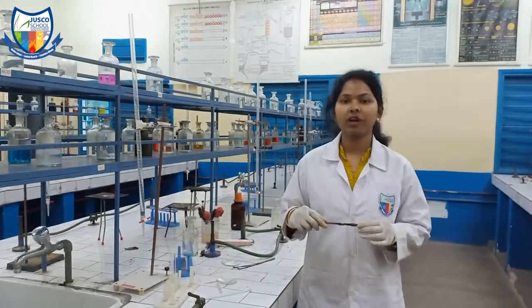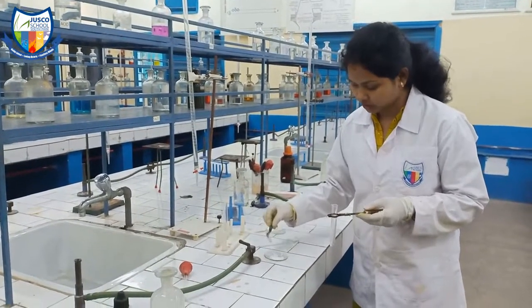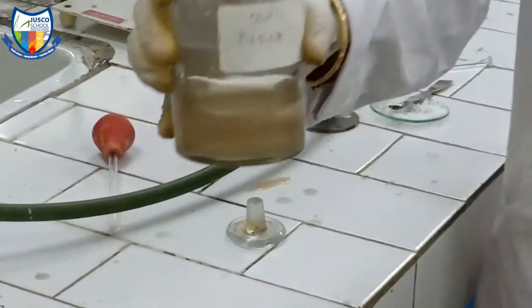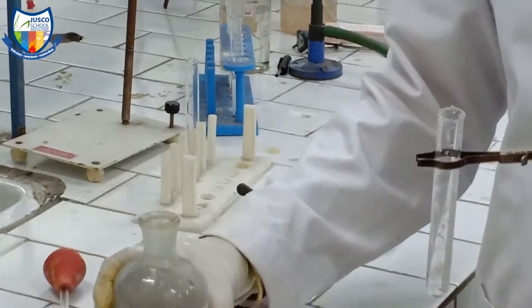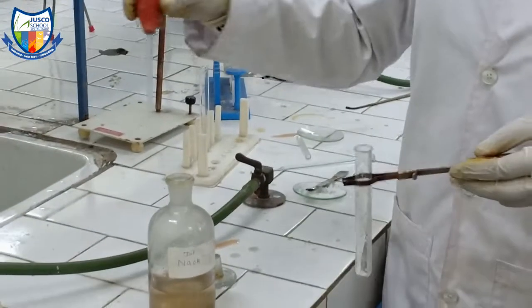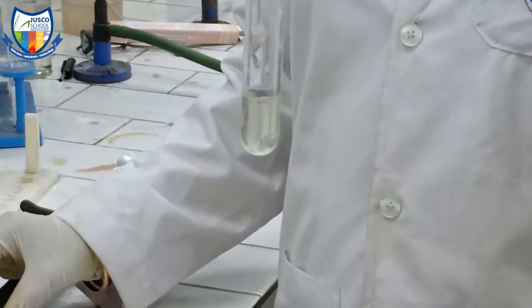Now we will do the test for the basic radical. For the first experiment, we take a pinch of salt in a dry test tube and add a few drops of dilute NaOH solution. You can see effervescence coming out in the form of small bubbles. This is an indication of ammonium.